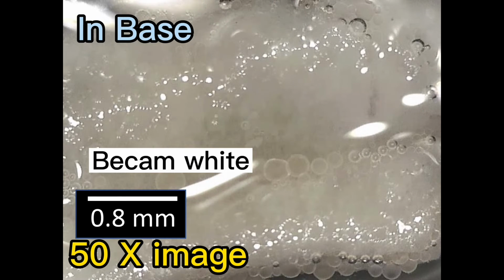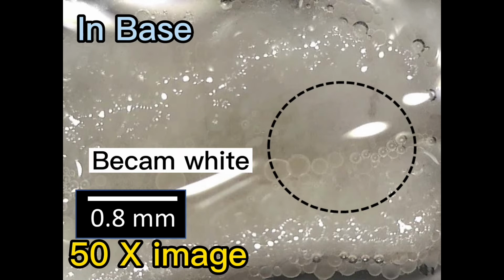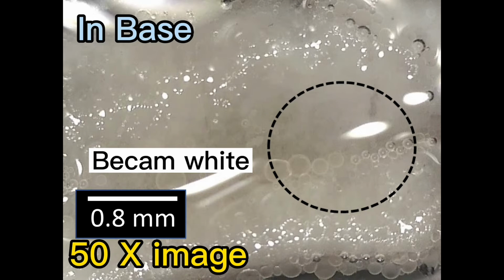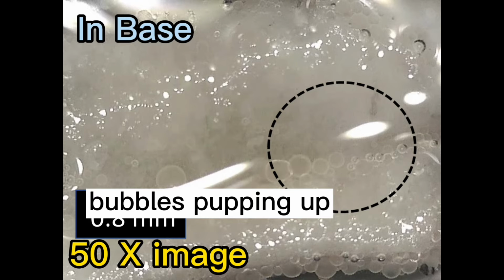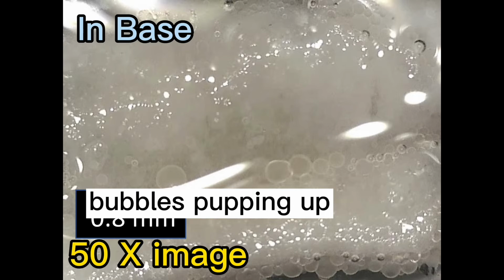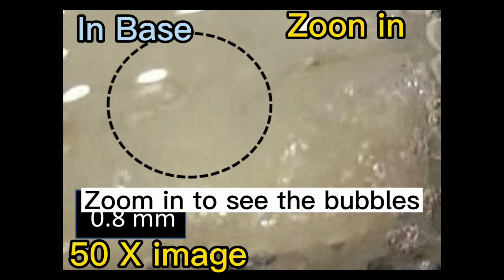At first, we found something like bubbles popping up. Let's zoom in and see again.